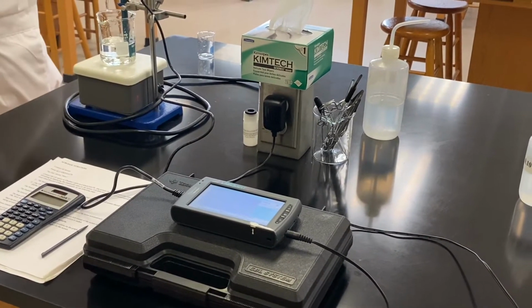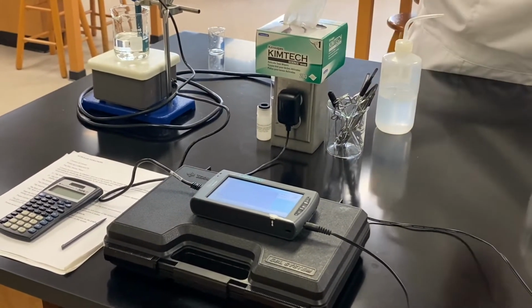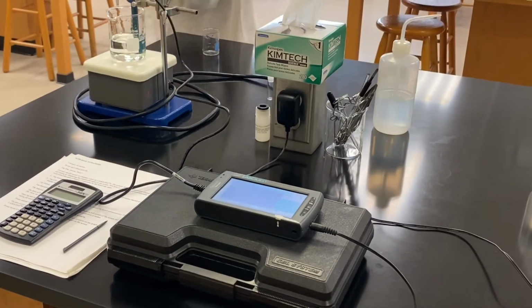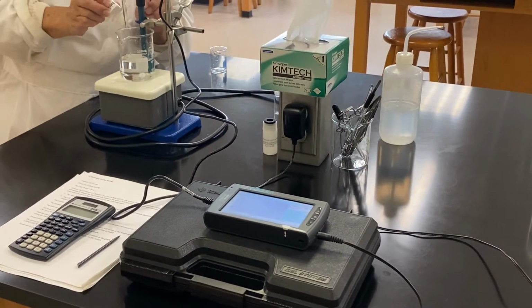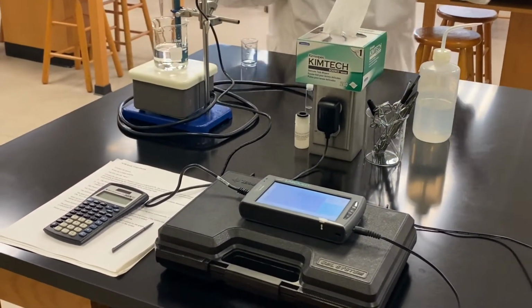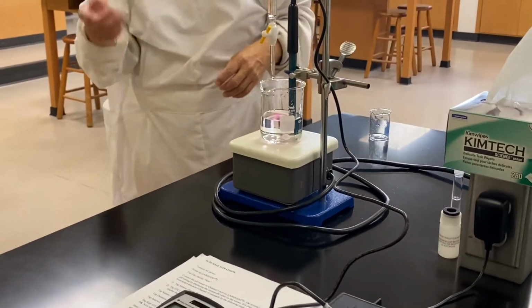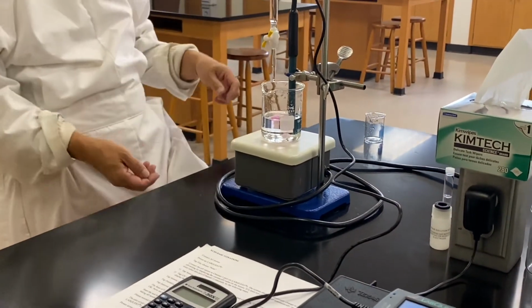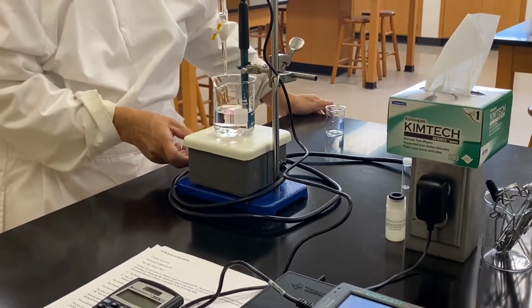Clear colorless base, clear colorless acid. Now, at the very beginning, you can do this, all right? So, 1, 2, 3. Don't ever forget to have your indicator. But at the end of a class, you will be asked, well, is that necessary?